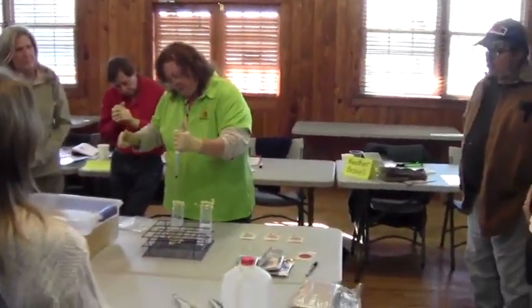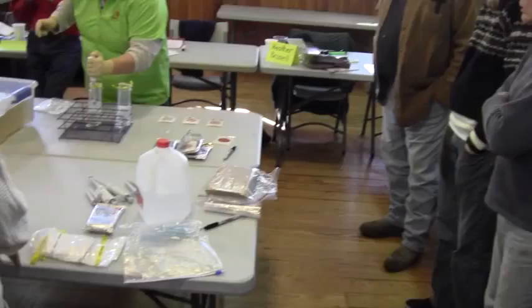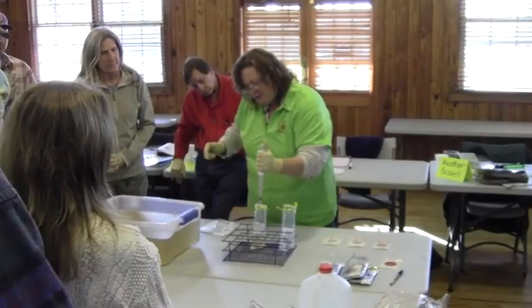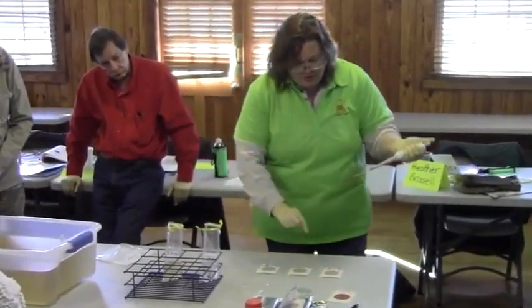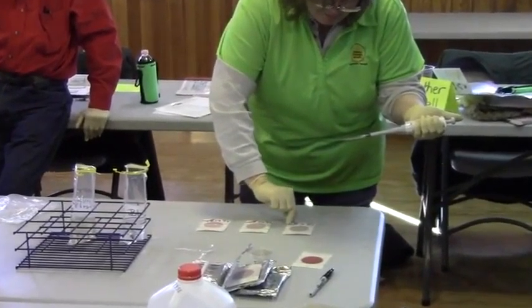So what am I doing first? All the way down — drawing it up. Am I going to quickly push all the water out? Slowly, slowly, slowly. Gently. Gently. That's all.